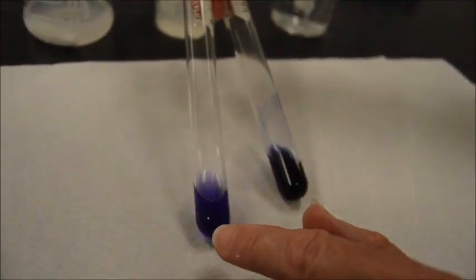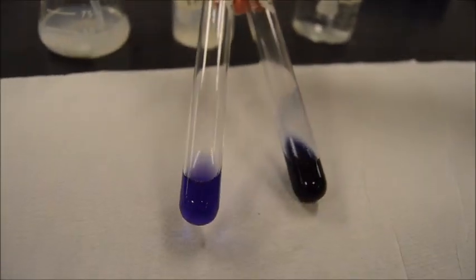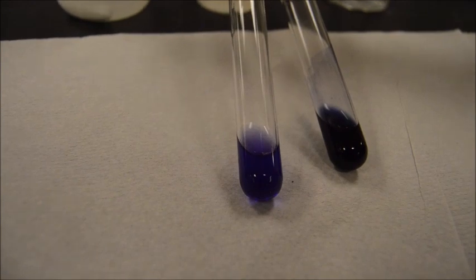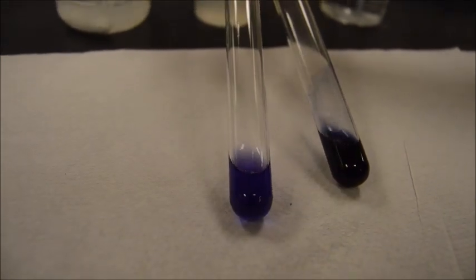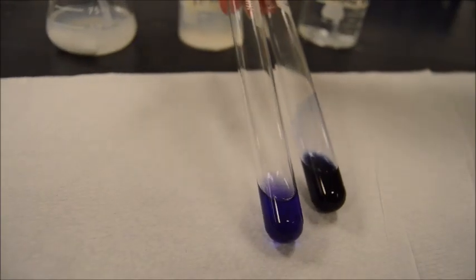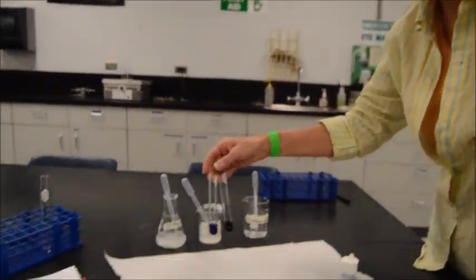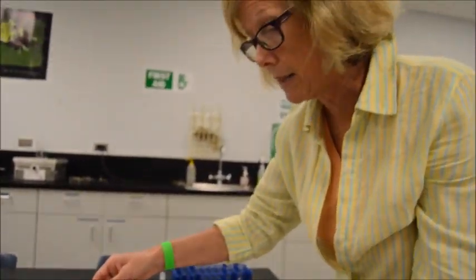The transparency really falls out too. You can see the starch is very dark. You can't see through that at all. Whereas here, this purple is very transparent. So those are just those two tests side by side, so that if you saw tubes from different tests on a lab test, for instance, you know the difference between what a positive starch test and a positive protein test will look like.